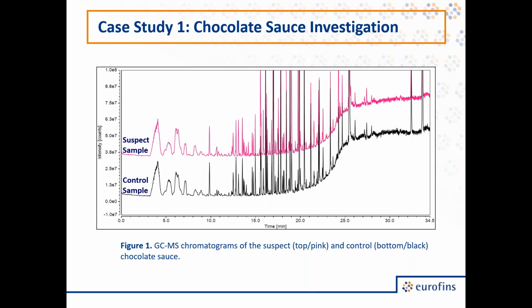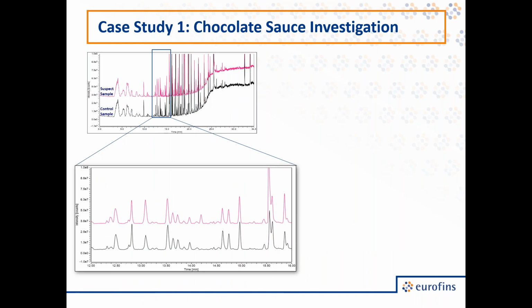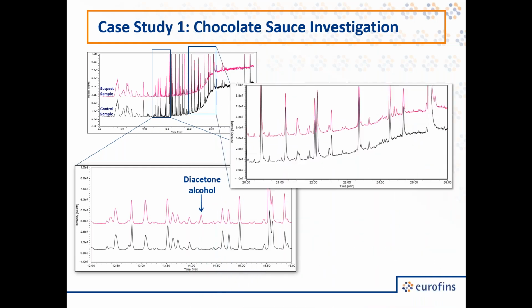So we have a huge amount of information just looking at these overall aromatic profiles, and when we have something this complex, to narrow in and really try to find the source of an off odor, we sometimes have to look very closely. So to start with, we're zooming in on this early chromatographic section. So the first thing we noticed is we identified this peak. This is found in the suspect and not the control sample, and this was found to be diacetone alcohol. And looking later in the chromatogram, we also identified tetramethyldecynediol, which was also found in the suspect and not the control sample.